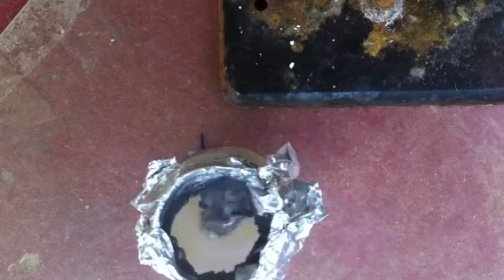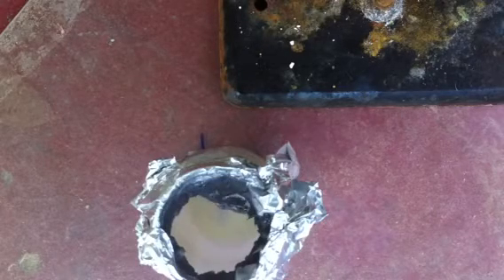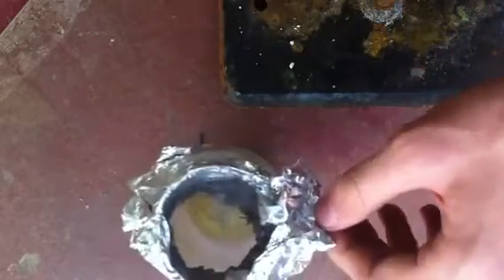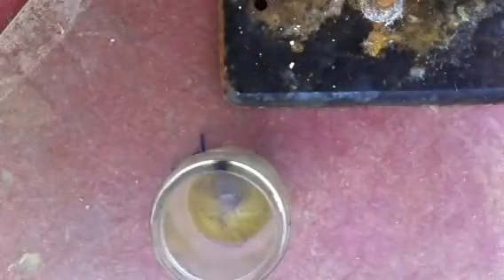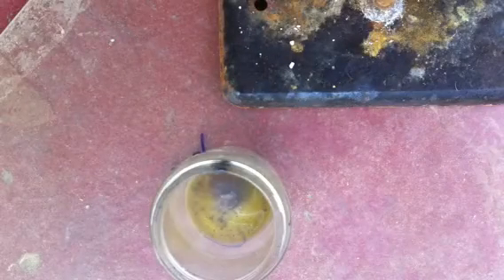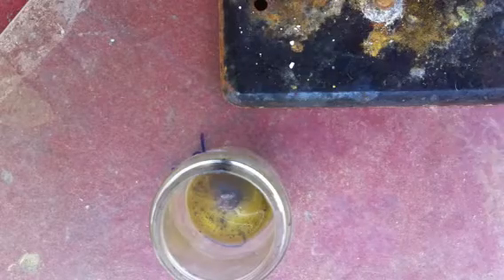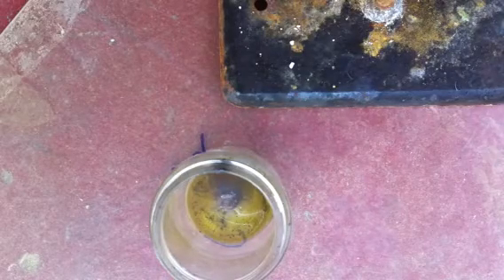And toxic gases are evolved, but then it is eaten away and copper is formed, as you can see right here. Now I'm going to get another sheet of this and do what the professor did and fold it up. Put it in there and add this to it.